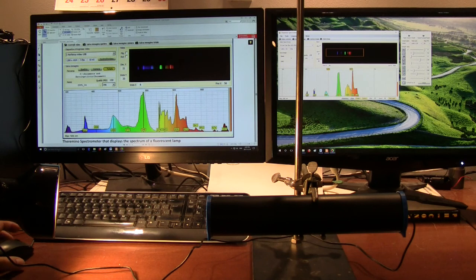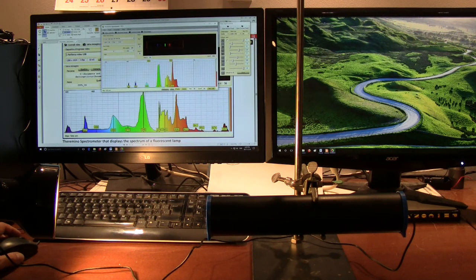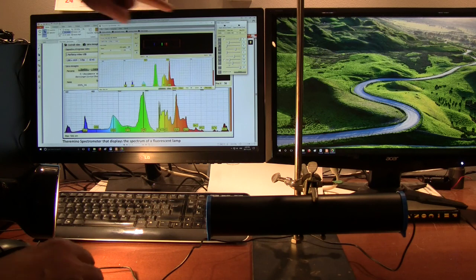So I'm just going to pull this over. They won't be to the same scale, of course, but we've got a control panel here that allows us to adjust a lot of the parameters for the webcam. And you can see we're at 546 on this line, and we're at 437. So we're actually in the right place with our trim.